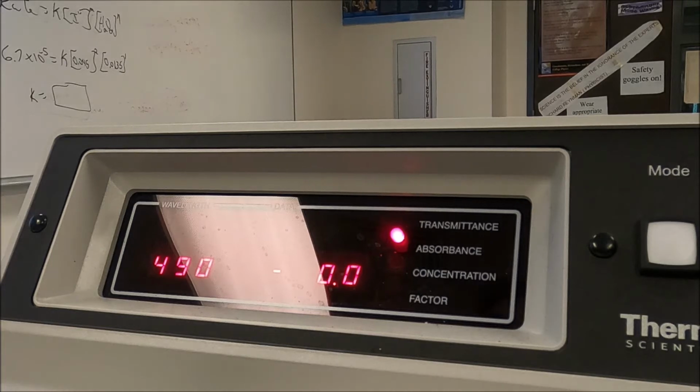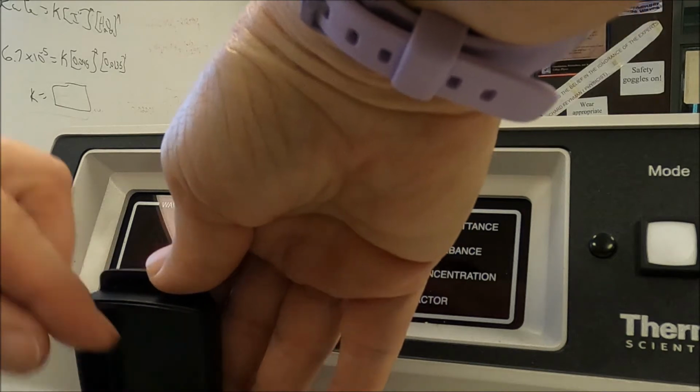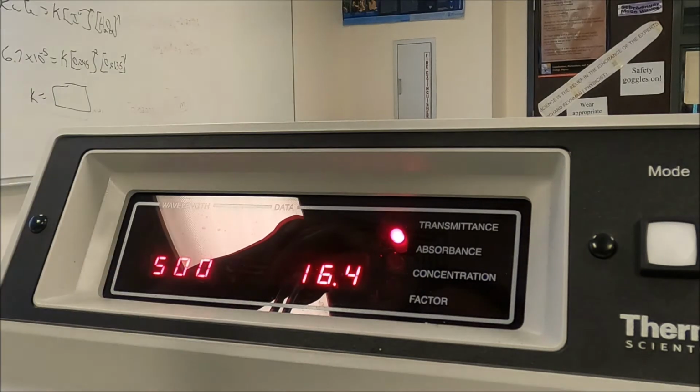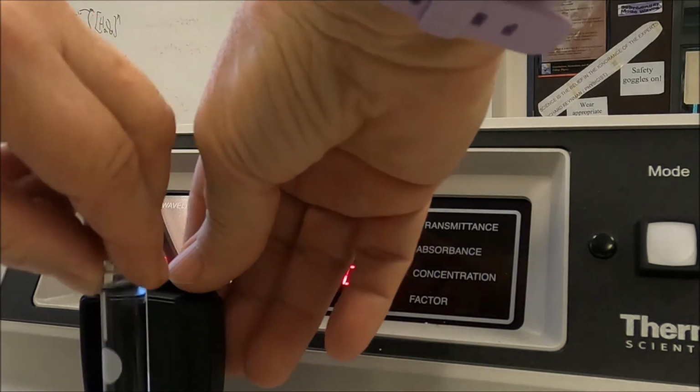We go to 500. Oop, I've done my zero. Is my 0 okay? Yeah, zero's okay.